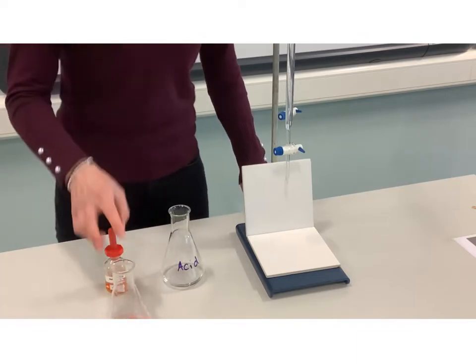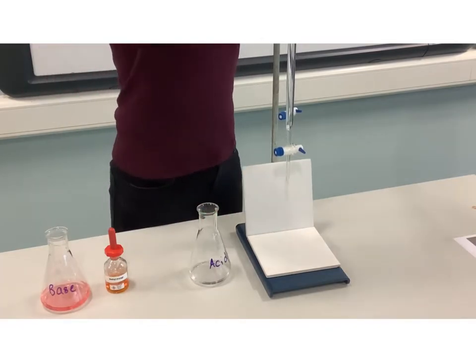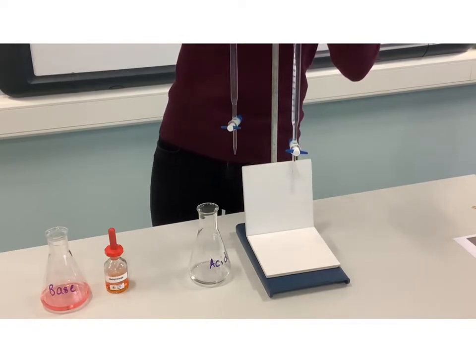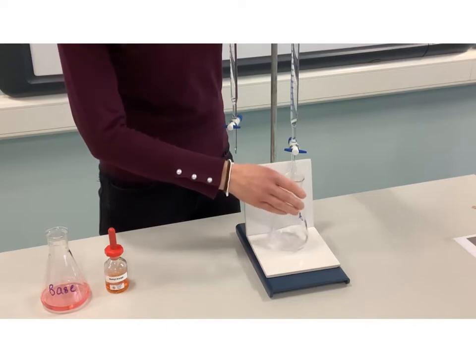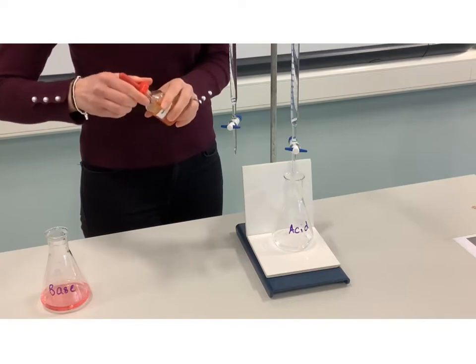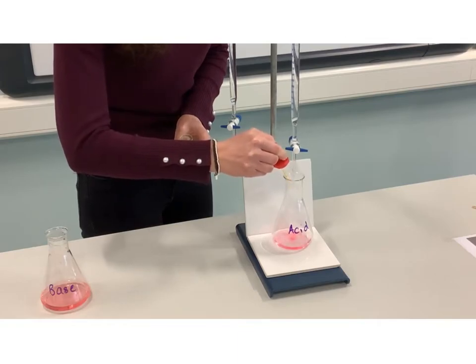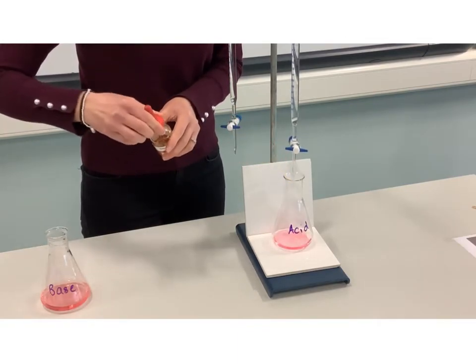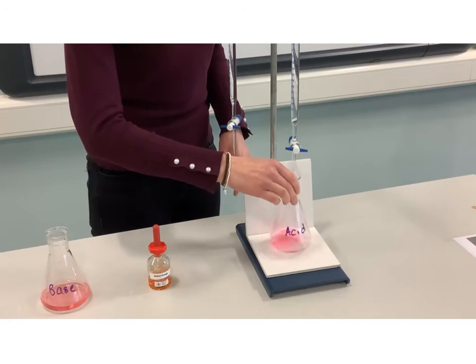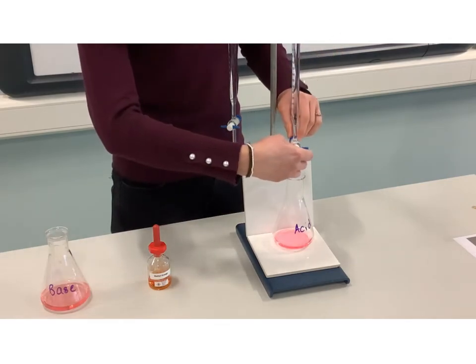Let's try it the other way around, starting with our acid in the conical flask. I'll move the burette round so that the base is being added to the conical flask from the burette. I've got acid in my conical flask — let's add a few drops of the indicator. You can have a think about what color you might expect. As you may have expected from the opposite way around to the last demonstration, our starting color this time is red.